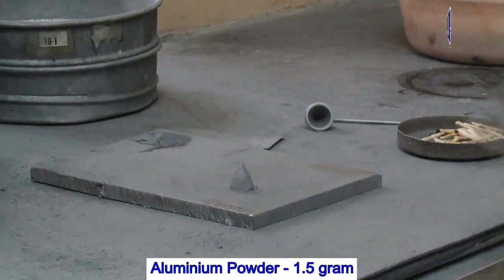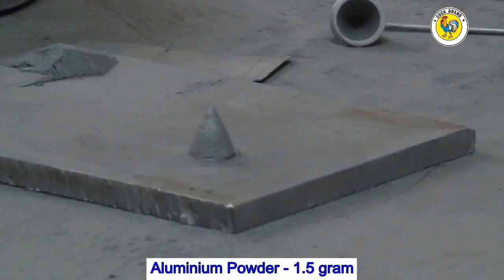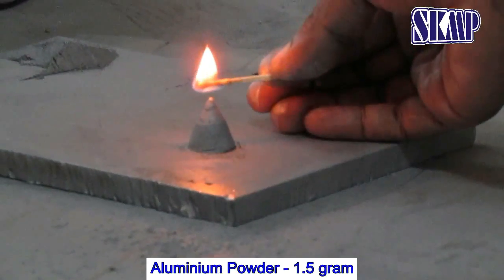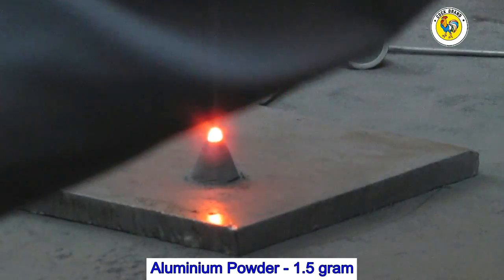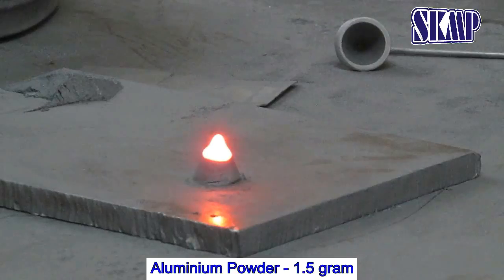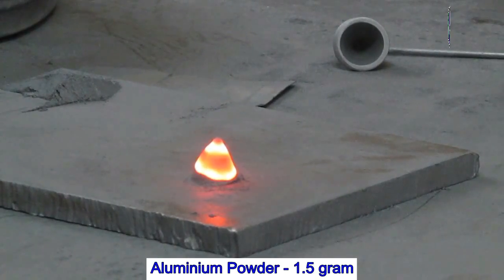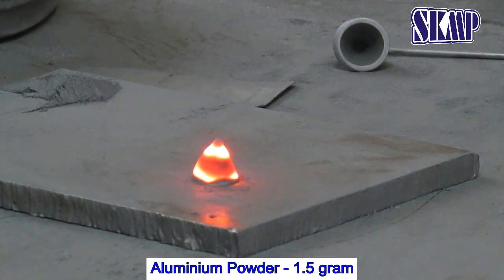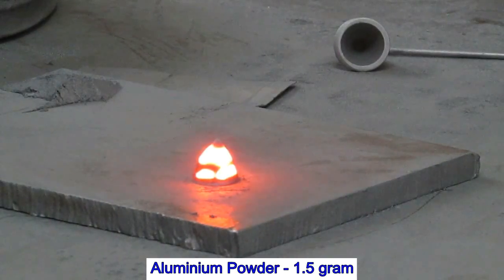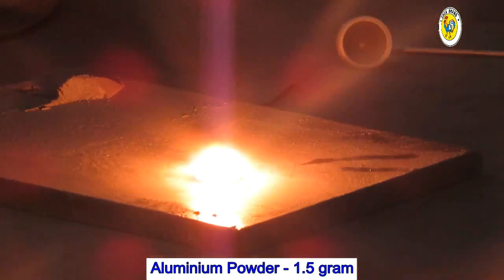Aluminium powder is formed into a cone shape using a die. I ignite the aluminium powder and it immediately catches fire. The fire continues to the bottom of the cone, and the time is recorded as spread time. This is the spread time. Now we can see the globe formed after burning.